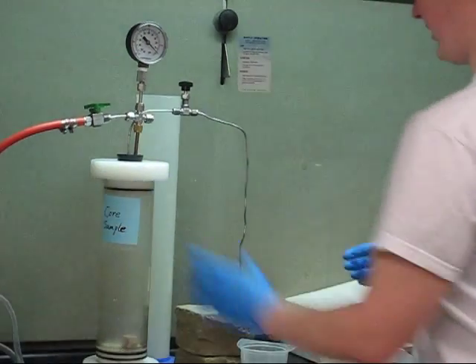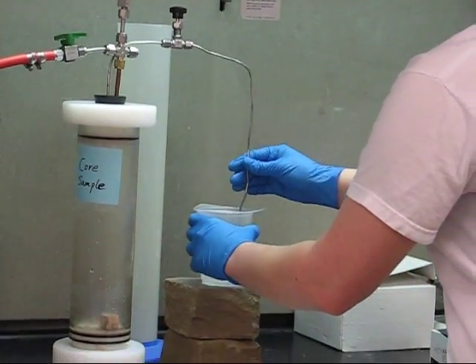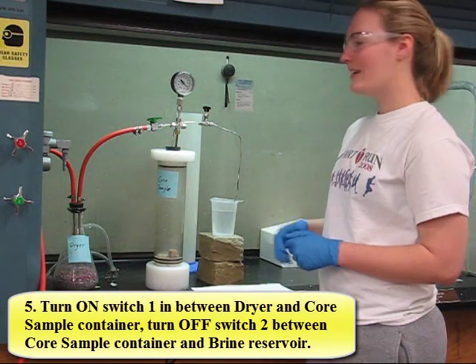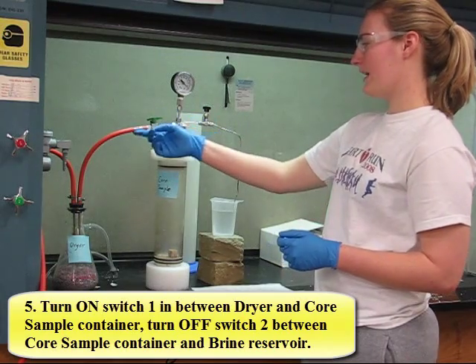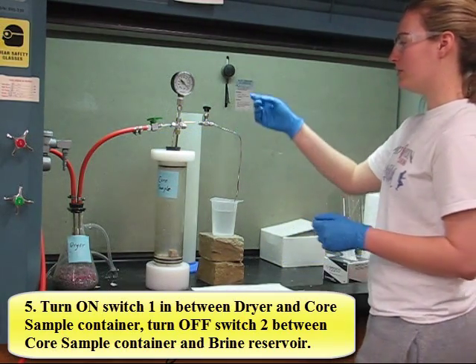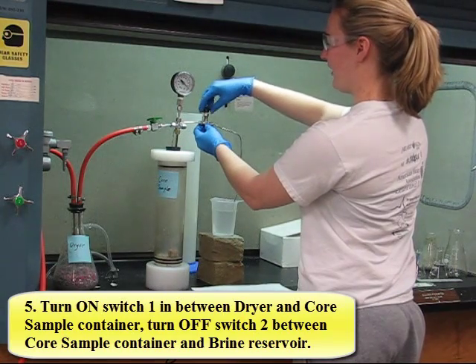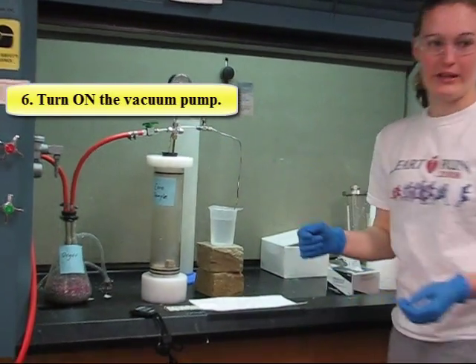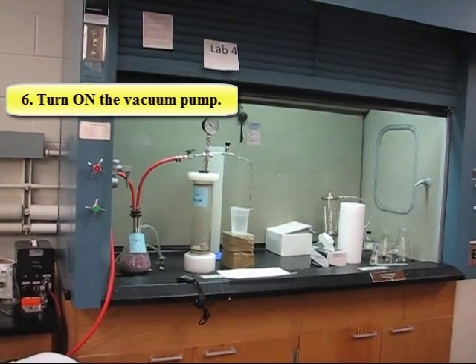Make sure that the lid is all the way down. Make sure that valve one is open — it's open when it's parallel to the lines — and make sure that valve two is closed by turning it clockwise. Then we're going to turn on the vacuum pump.